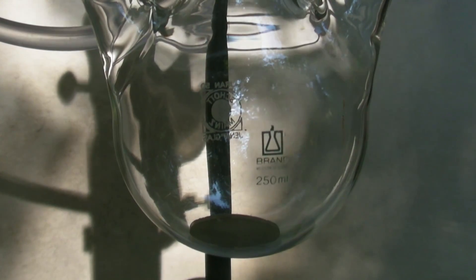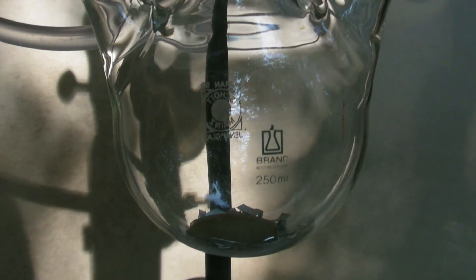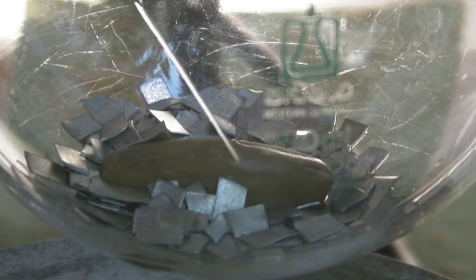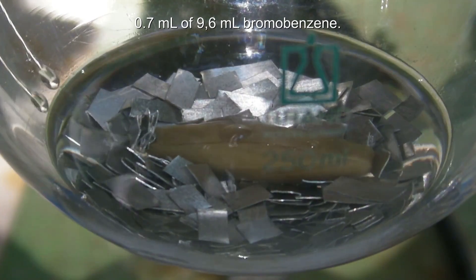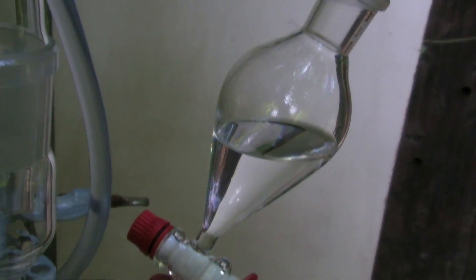When the apparatus has cooled down, 2.3 grams of magnesium are added to the round-bottom flask. Cut-up magnesium ribbon is used here. There is a specially purified magnesium available for Grignard reactions, but it is much more expensive. Powder must not be used because it would react too fast and the reaction could become dangerous. Anhydrous ether is then added until the magnesium is just slightly covered. About 0.7 ml of bromobenzene, taken from a total of 9.6 ml, is added. The rest of the bromobenzene is mixed with 30 ml of anhydrous diethyl ether and filled into a dropping funnel connected to the flask.